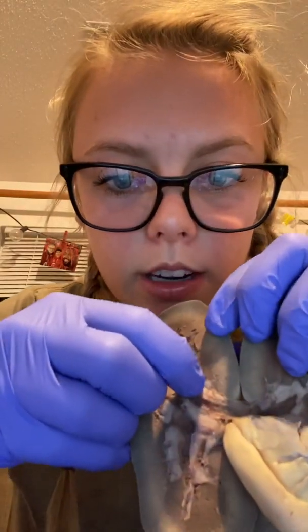And inside the renal sinus is the renal hilum, I believe is how you pronounce it. So it's in this portion right here. And then you're going to have the minor calyx, and then into that is the major calyx, that white portion right there. And then the renal pelvis, which is right here. This portion is the renal pelvis. And then this is the superior portion of the ureter.